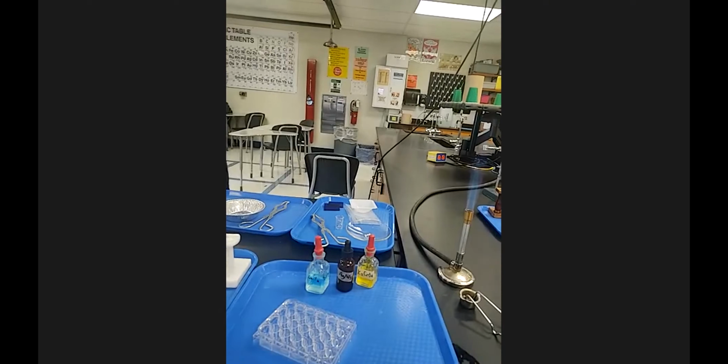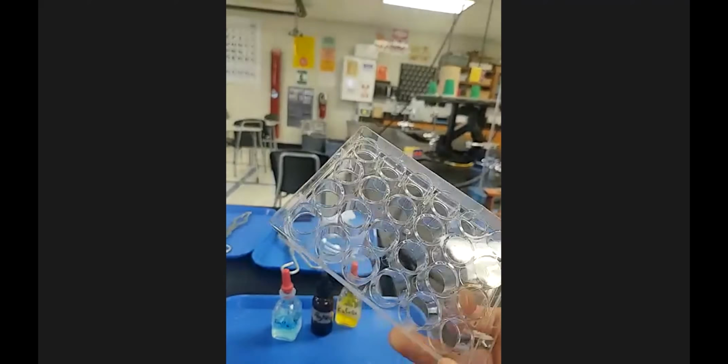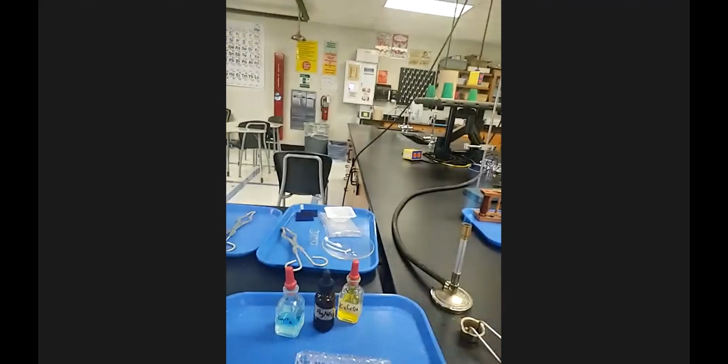All right, station 5 says get a well plate. I switched it up from last hour. I got a better well plate. This one's a little bit deeper. I'll go show you the one I used last hour. There's different wells.